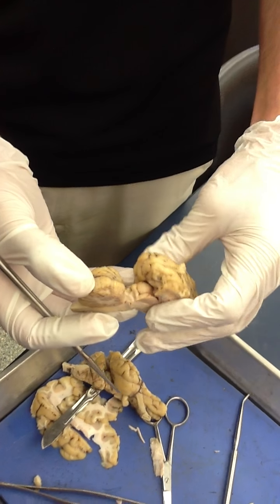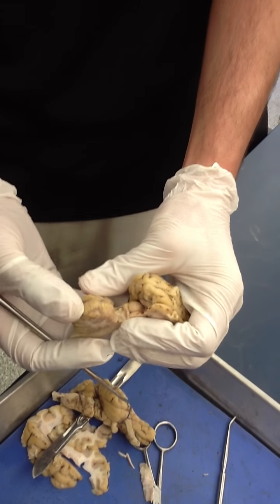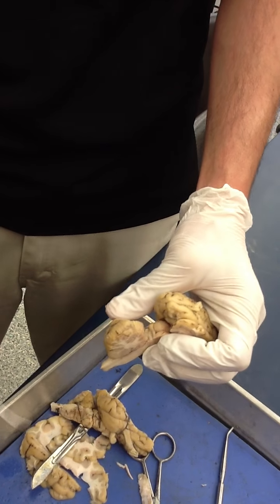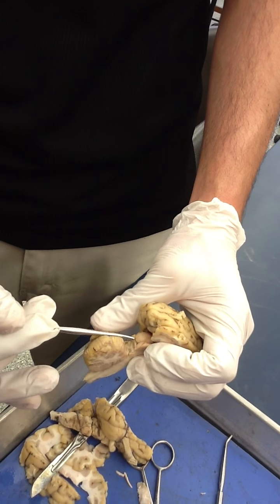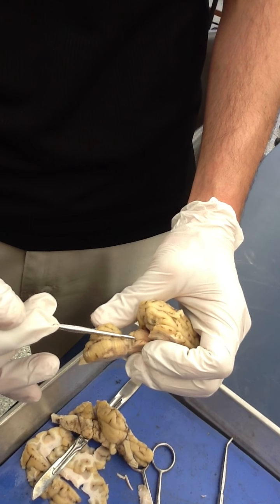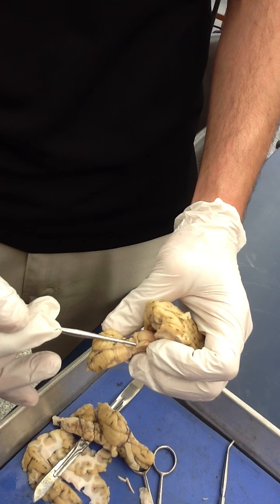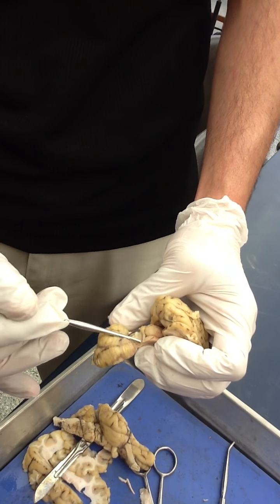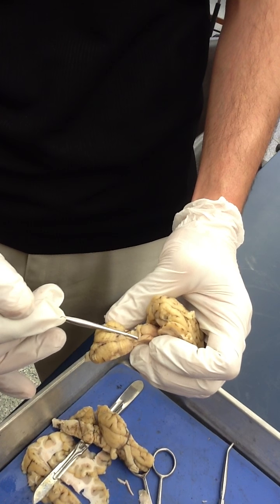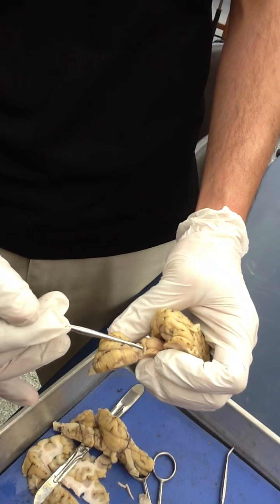I've actually made that sagittal cut a little bit askew, so we actually see both the right and left superior colliculi, and then right and left inferior colliculi — one, two, three, four. Corpora quadrigemini.